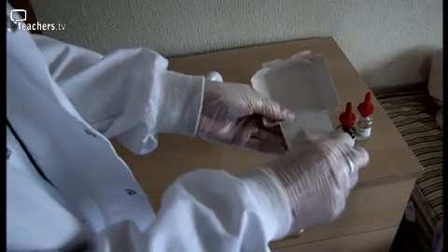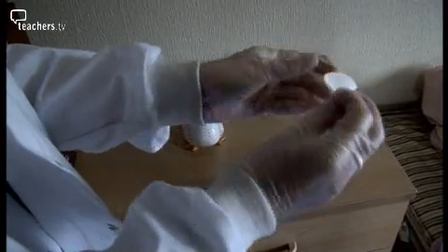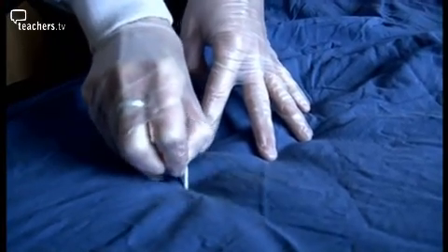And hydrogen peroxide is the same stuff you use to bleach your hair. We take a small piece of filter paper and take a very small sample of a blood stain that we can see, or an area that we want to test, maybe where we can't see any blood but there may be some there. To demonstrate Kastle Meyer, we placed a trace amount of blood on a bedsheet. What we then do is apply 2 chemicals to the filter paper where we've used to sample an area.